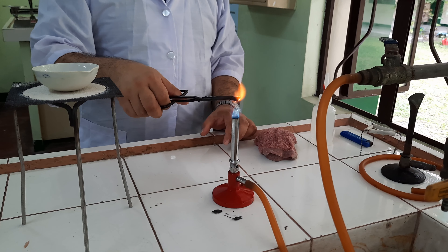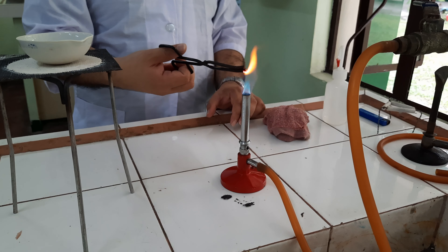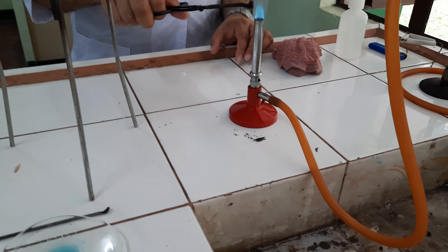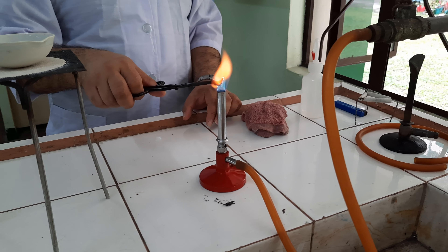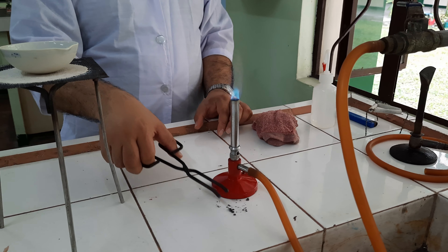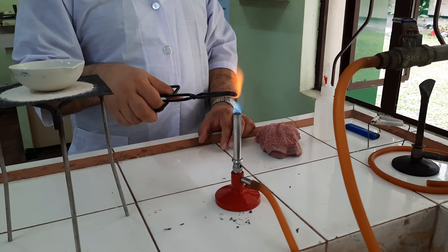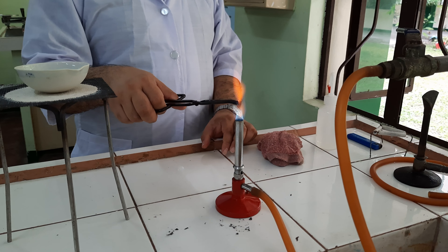What have you noticed about the burnt piece of dried leaf material? Even after it got charred, we continue the burning. What had become of our dried leaves as heating, burning, or ignition continues? This is quite comparable to our earlier demonstration on the ignition of activated charcoal.